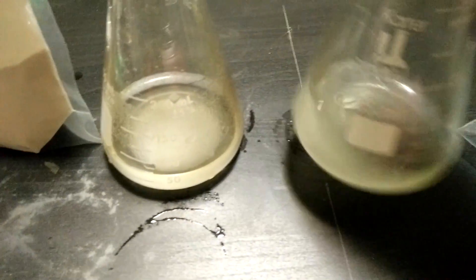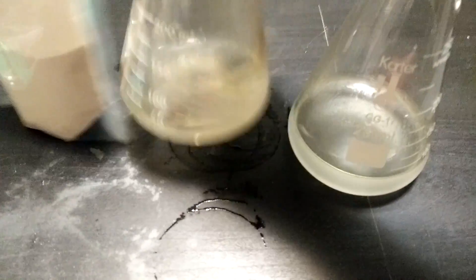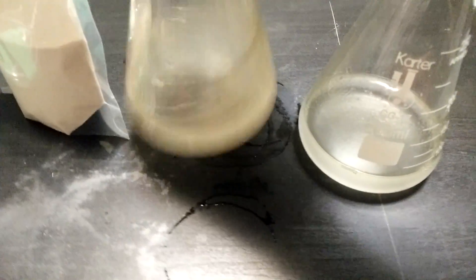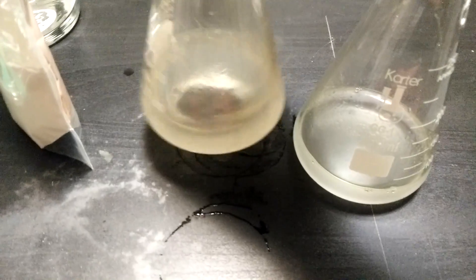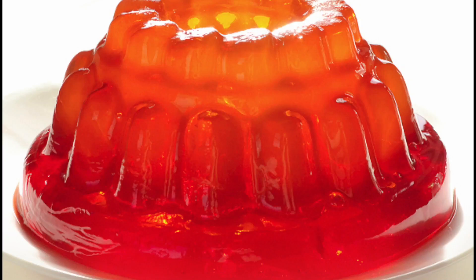The procedure to make the membrane is always the same regardless of which gel you're going to use. Mix them at a ratio of one and a half grams of your gel material for every 100 mils of water. Then either heat it on the stove or in a microwave so that it dissolves - it works the same way as jello. Speaking of which, no you can't use jello or gelatin; they degrade very quickly and are basically useless.